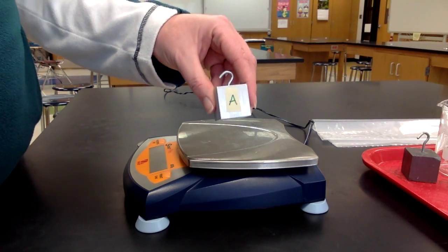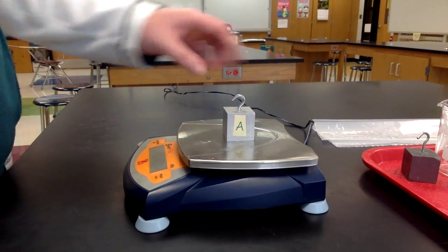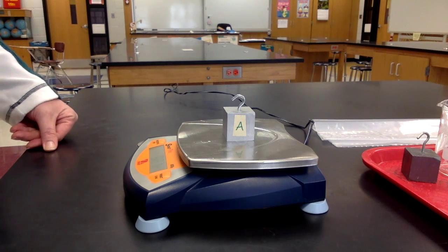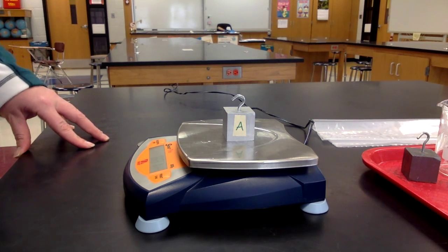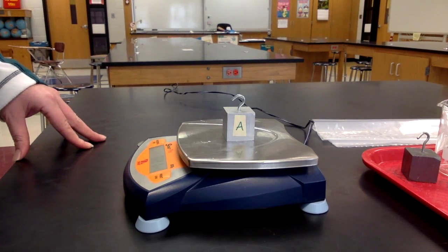Take block A. Place it on the scale. Read the number on the scale and record. Make sure you record the unit.